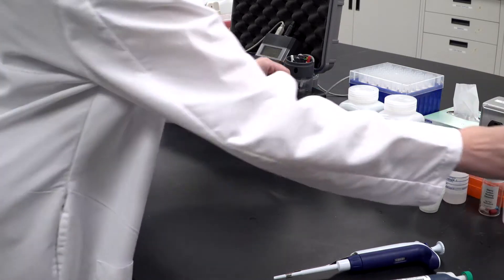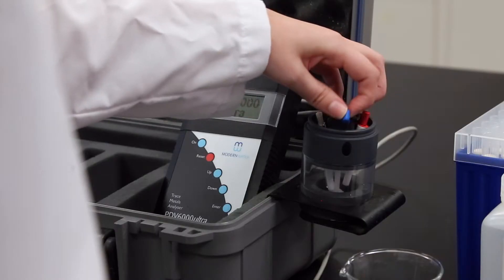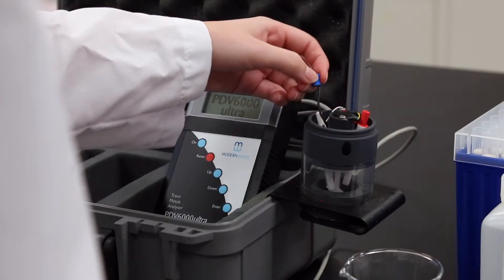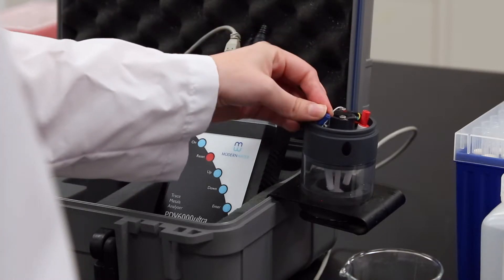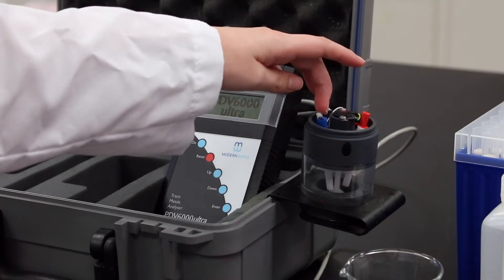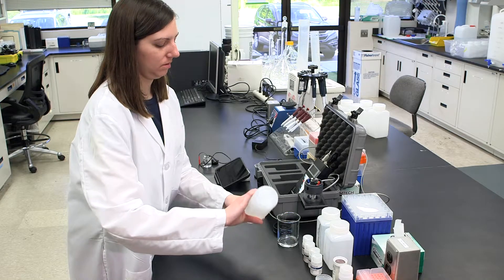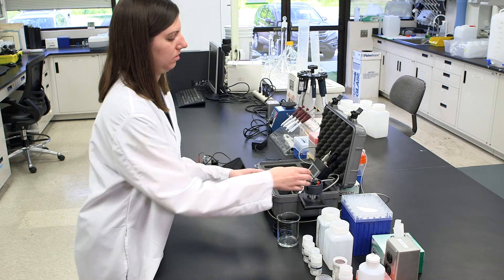Remove the black cover from the top of the cell and place the electrodes in the appropriate color-coded holes. Attach the color-coded leads to each electrode connector, and if preferred, refit the cell cover to protect these connections and ensure all electrodes are pushed down to their proper depth. Place an analysis cup filled with 20 milliliters of deionized water in the analysis cell.